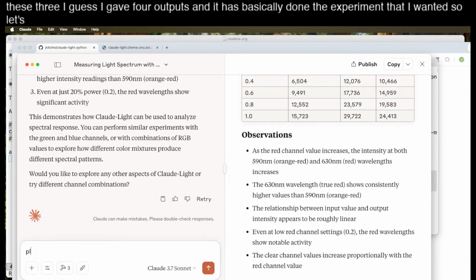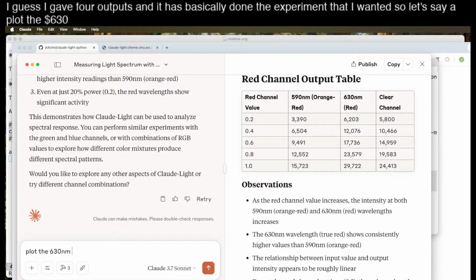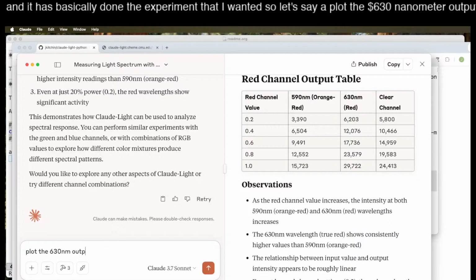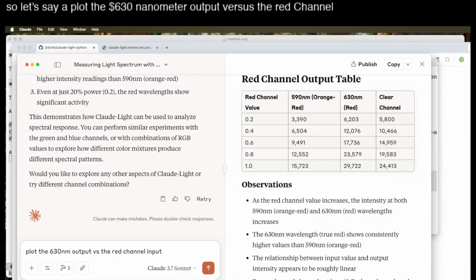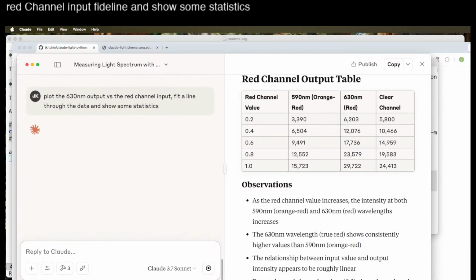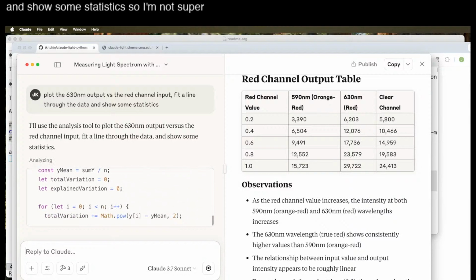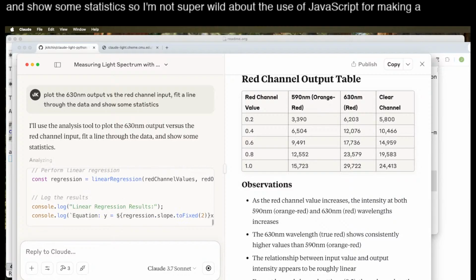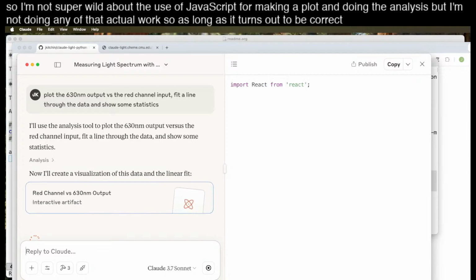So let's say plot the 630 nanometer output versus the red channel input, fit a line, and show some statistics. So I'm not super wild about the use of JavaScript for making a plot and doing the analysis, but I'm not doing any of that actual work, so as long as it turns out to be correct, I think that'll probably be okay.